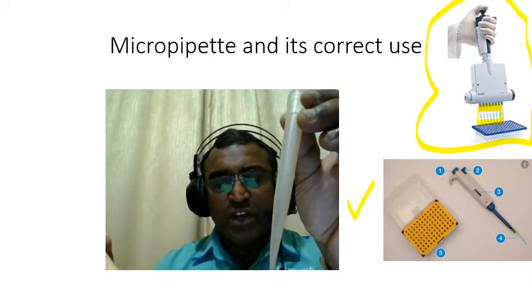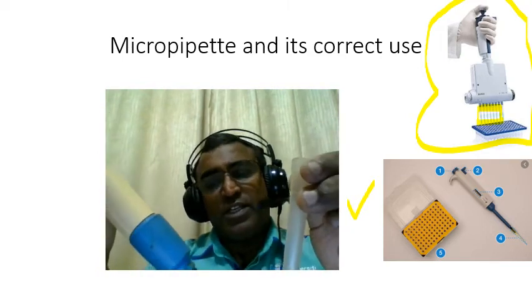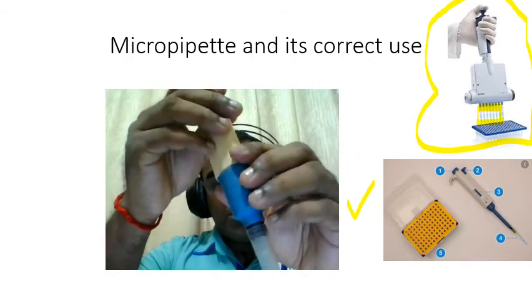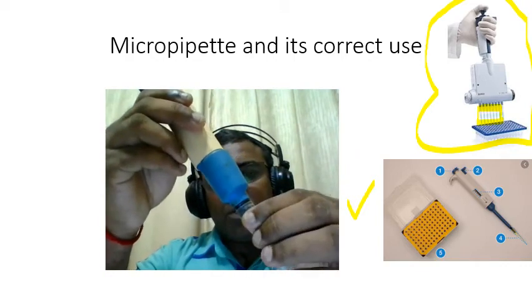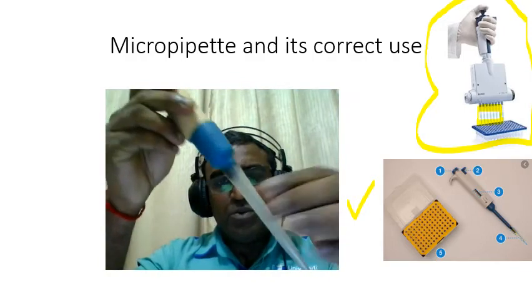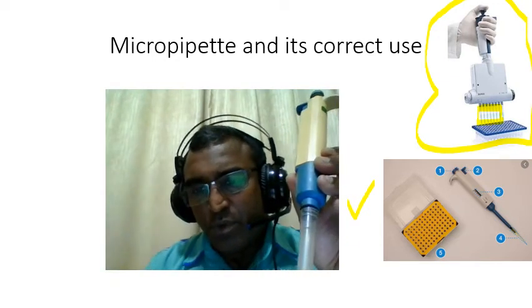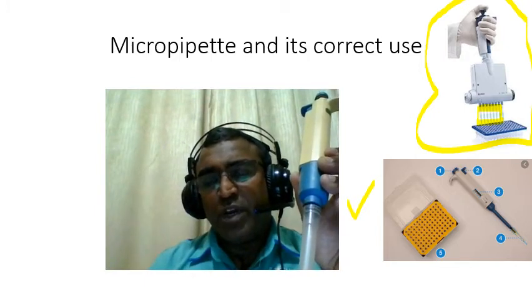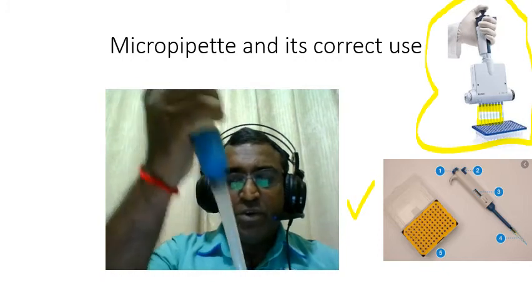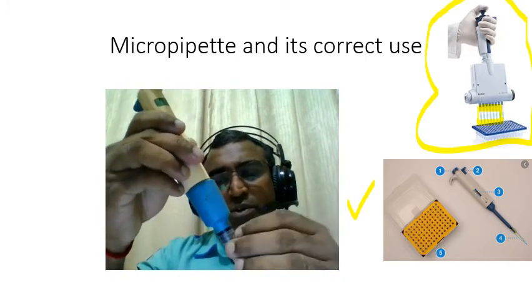These are the tips for this 5 ml micropipette. I purposely chose a big micropipette so I can show it to you easily. So the next thing is to put on the tip here. For this one I use my hand to adjust or tighten the tip at the bottom. But if you are working with microbes, it is not advisable to hold the tip without a glove. You can also resort to using what is shown in the photo, number 5 there. It's a rack where you have already autoclaved your tips and dried them. Therefore, you just use your hand to go to the tips and press, and it should get tightened on the end here.